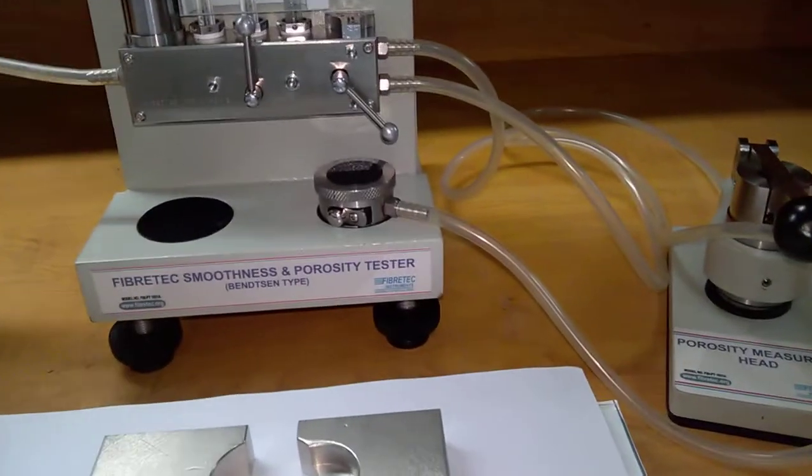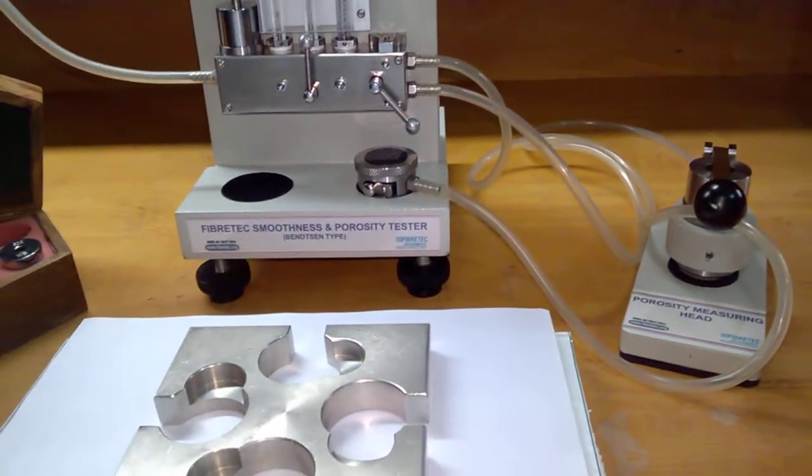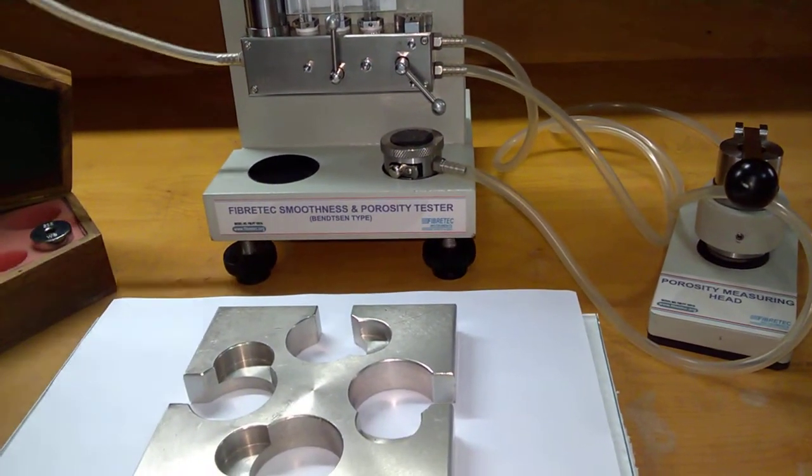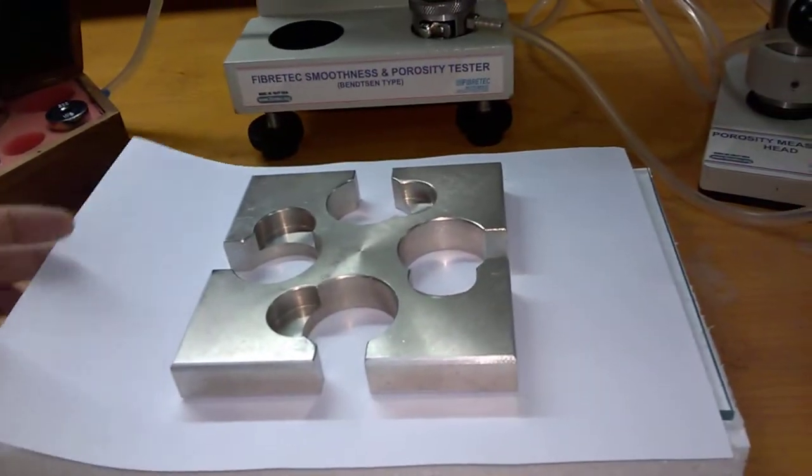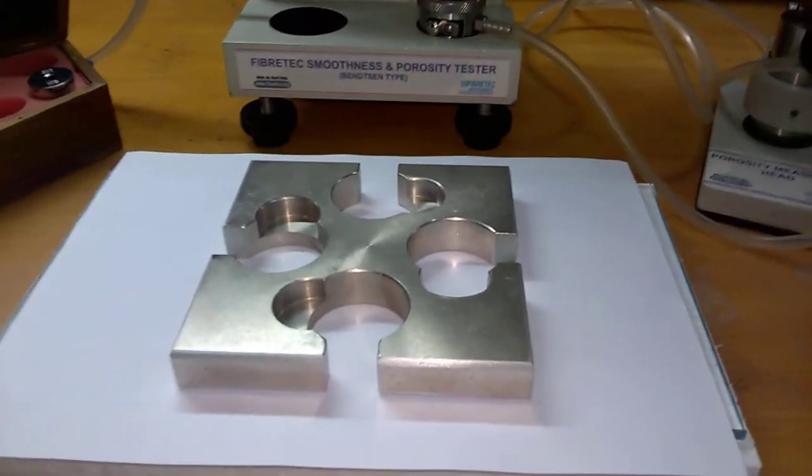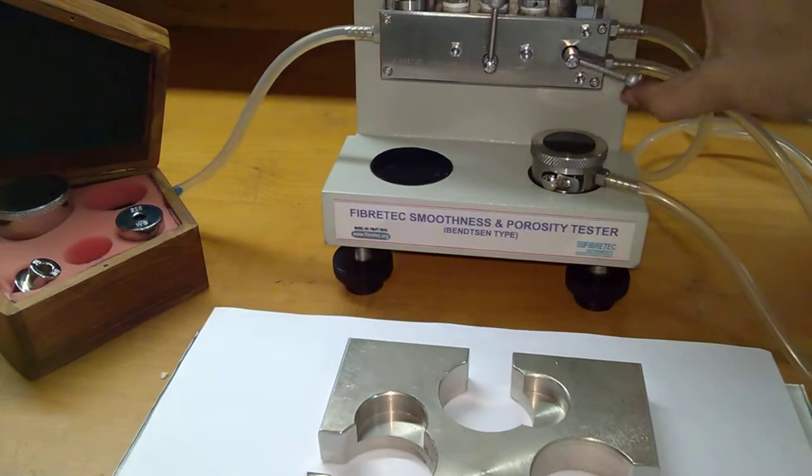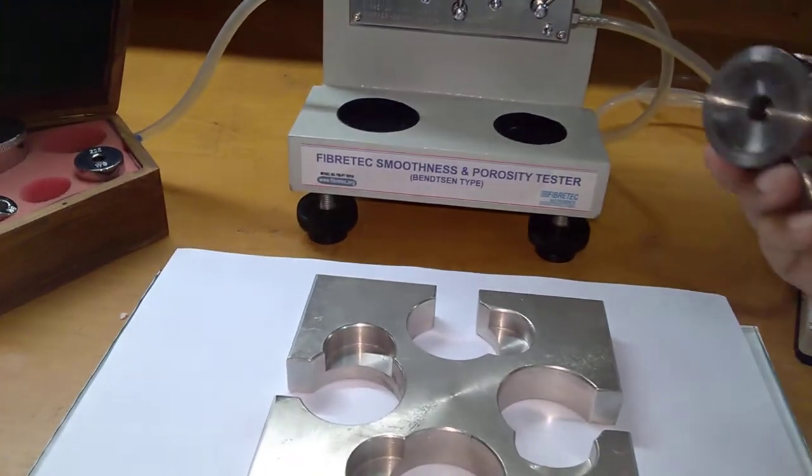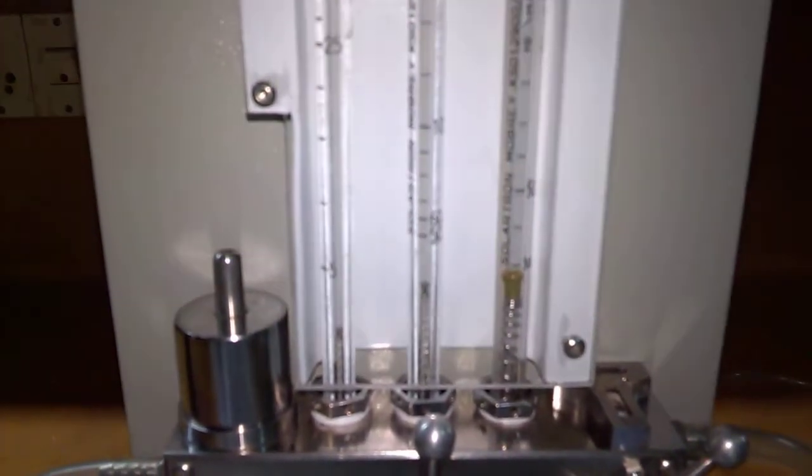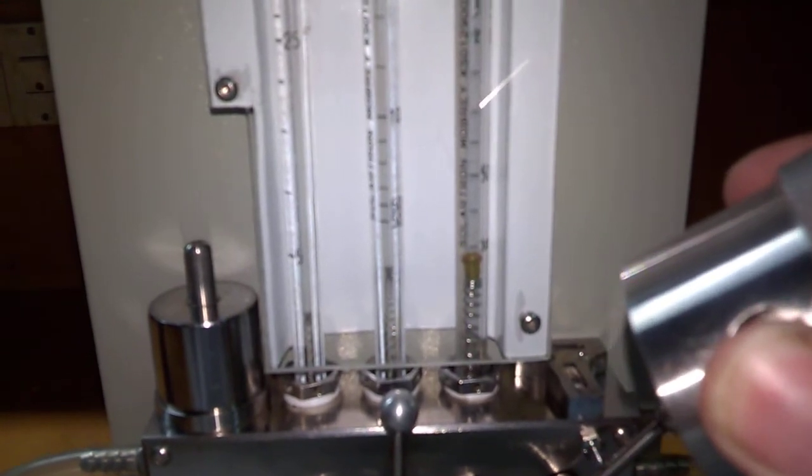You can connect the filtered air through here, and this is the specimen we have to test. I am connecting it to the smoothness head. You can see when we press it, it is showing zero.